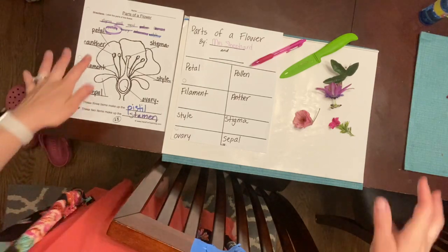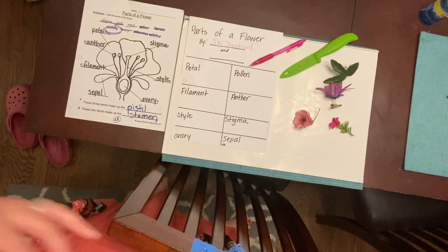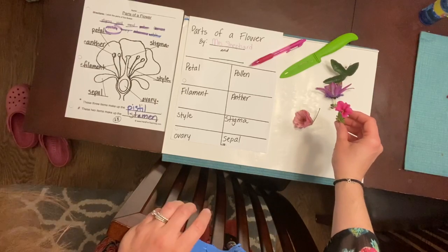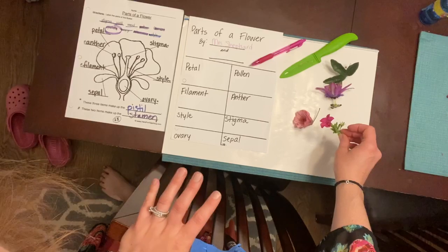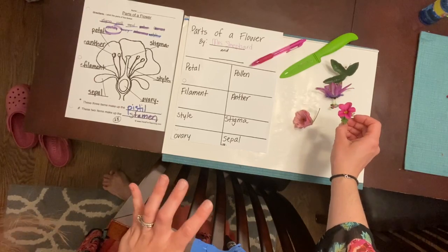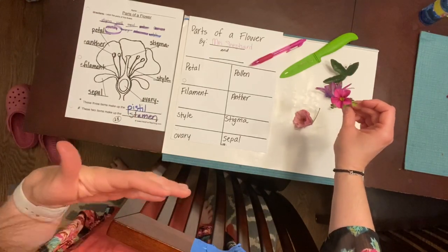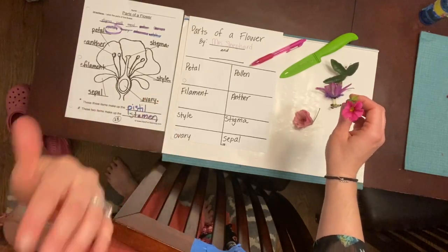Now, before you get started and you've gathered these supplies, you also need to find a flower to dissect. And I live in a house and we have some flowers in our backyard. So I went and, sometimes it's kind of sad to pick some flowers, and I don't normally recommend picking leaves or too many flowers off of a plant, but scientists need to learn about the inside of different living things. And so sometimes they do dissections. And a dissection means cutting apart a living thing after it is no longer living, cutting it apart and looking at all the parts inside.